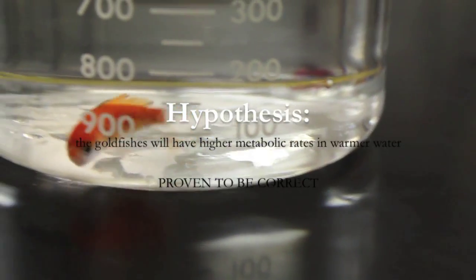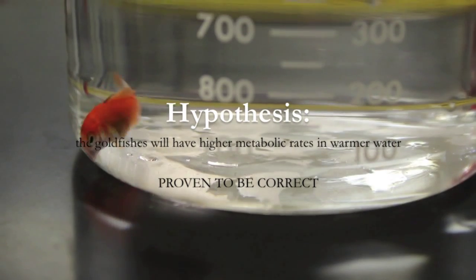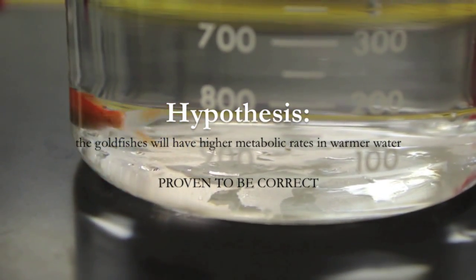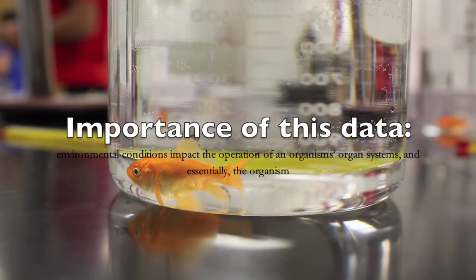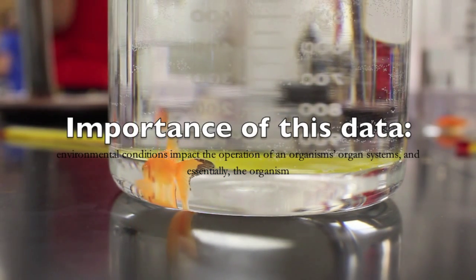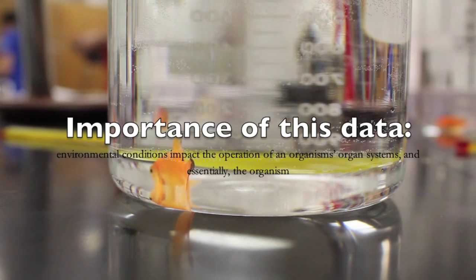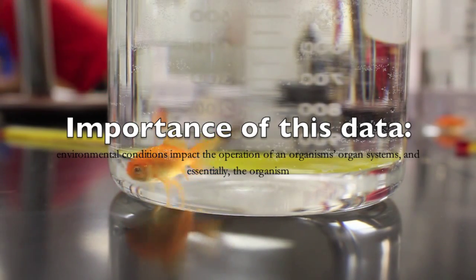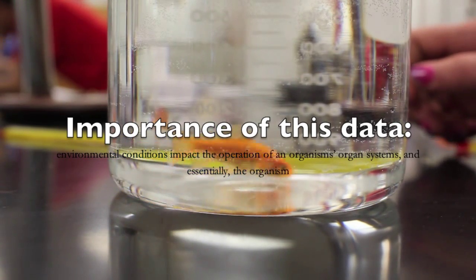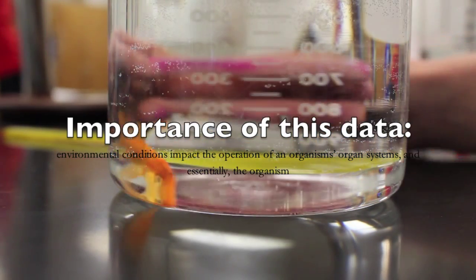Earlier, we predicted that the fish would have a higher metabolism in the warmer water. This is proven to be correct because our results showed that the fish had the highest metabolic rate in the warmer water. This data matters because it gives us an accurate example of how the water temperature affects the metabolic rate of goldfishes. Because environmental conditions impact the operation of an organism's organ systems and essentially the organism, it is important to be aware of certain limitations when it comes to water temperatures in a goldfish's environment.